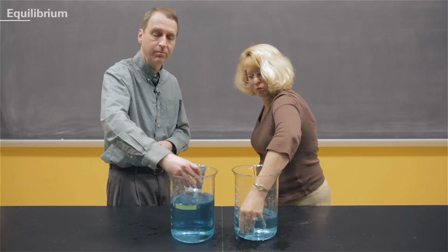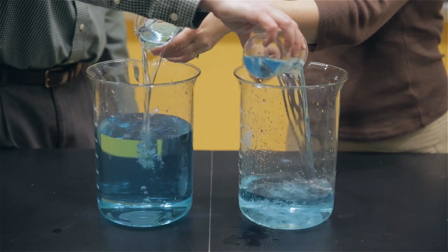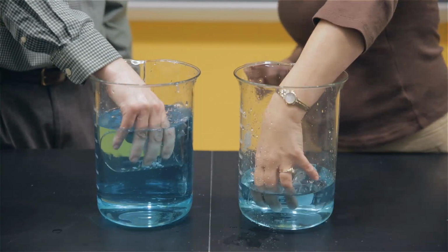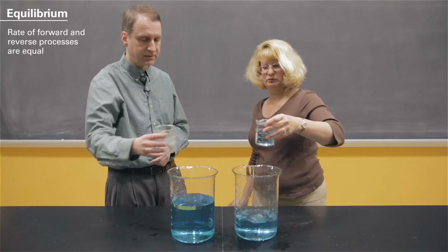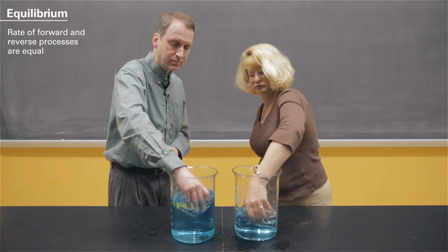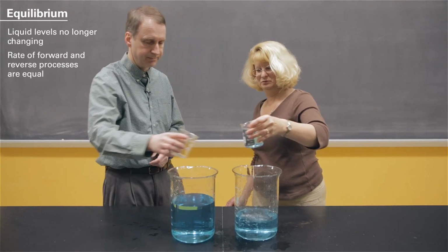We have reached equilibrium now, and the rate of the forward process, left to right, 250 milliliters, is the same as the reverse process, right to left, 250 milliliters again. The other thing to notice, the other characteristic of this system, is that the levels in the big beakers are no longer changing. So that again is a system at equilibrium.